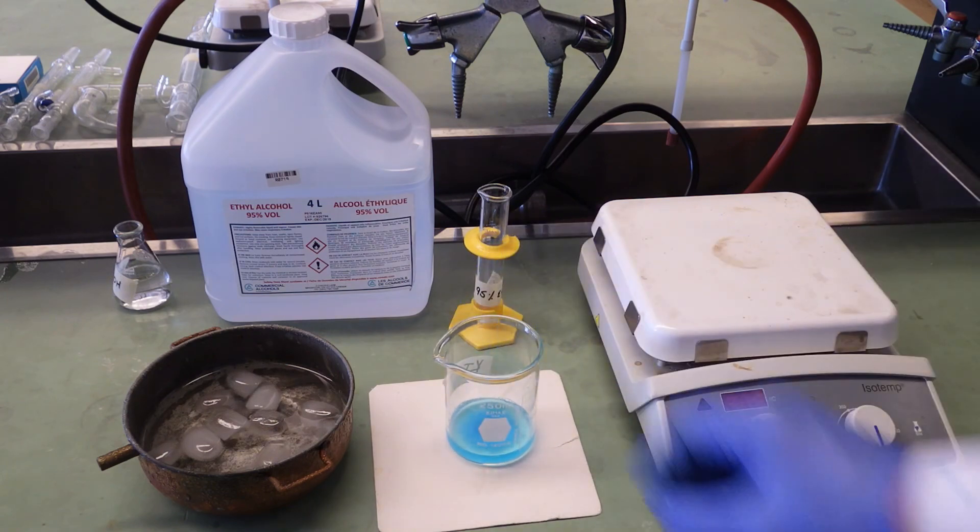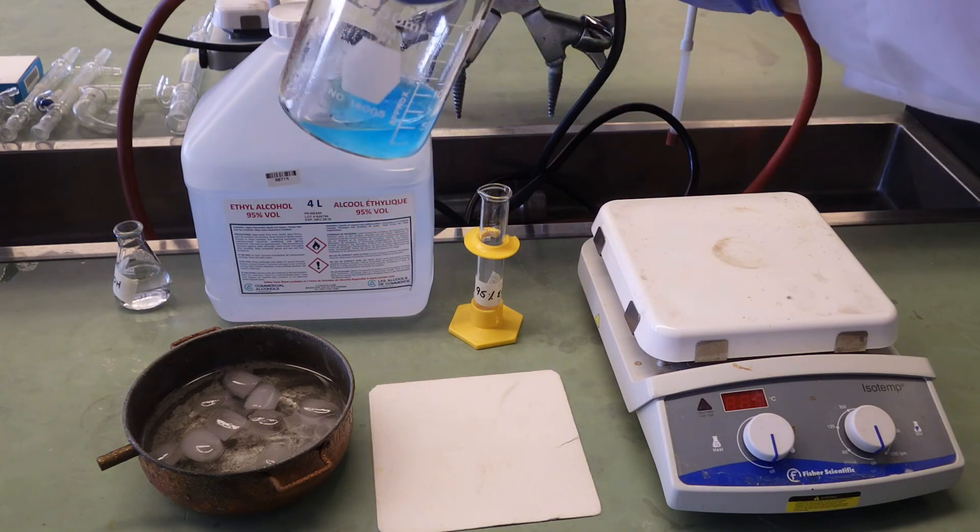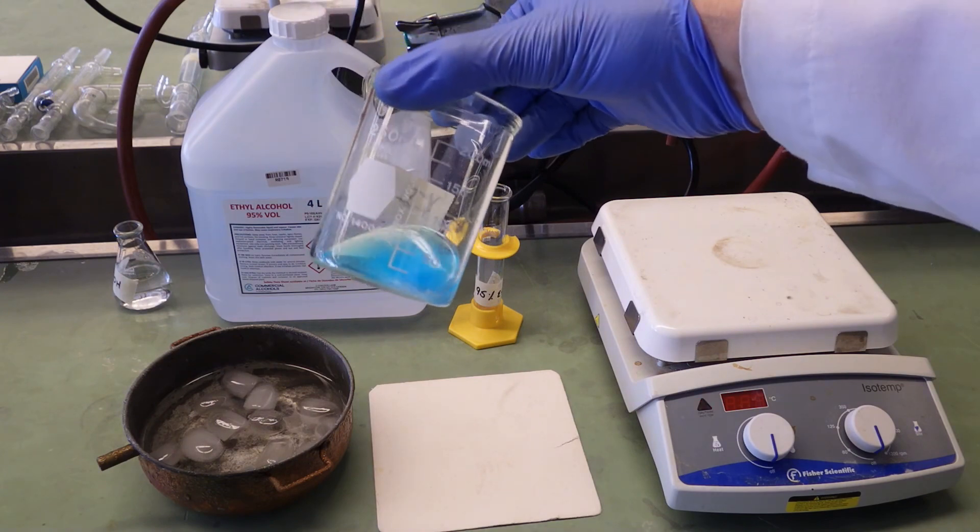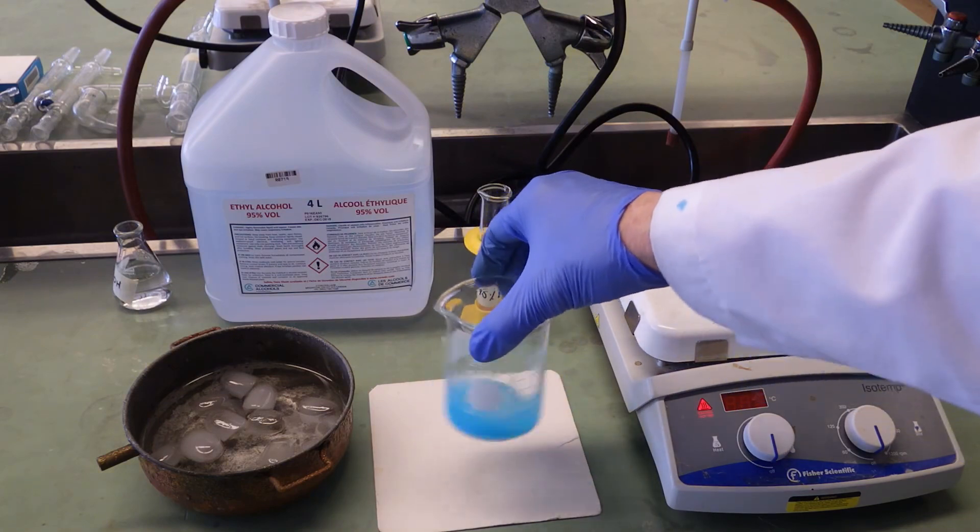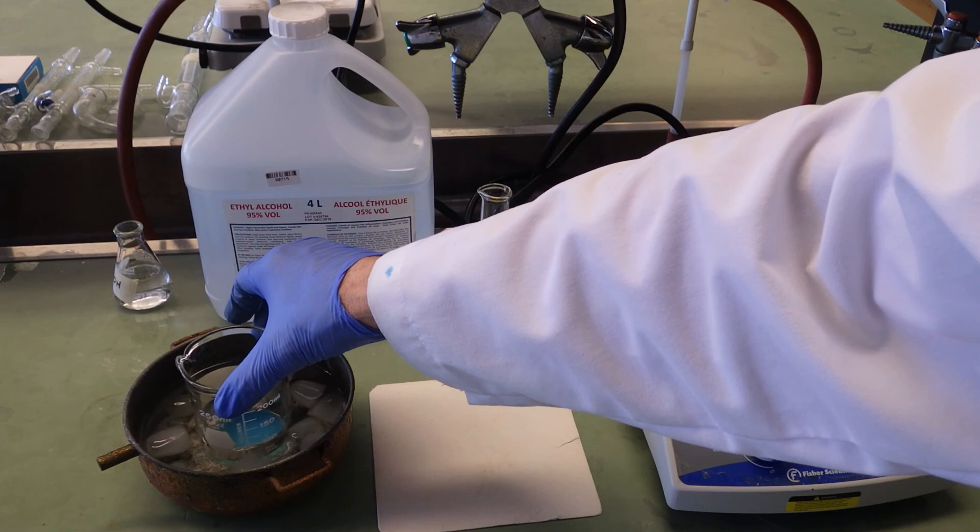Now coming out quickly like this, you realize we won't be able to grow large crystals, but the assumption is that we have eliminated most of the impurities. We've removed the salicylic acid; we have to get the CSP out of solution in order to weigh it. We'll finish up with the ice bath before vacuum filtration.